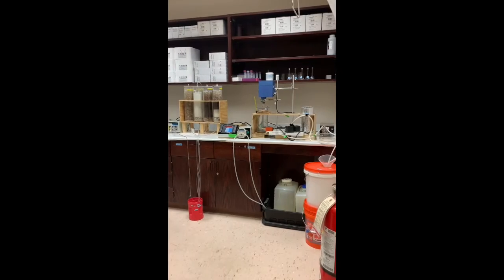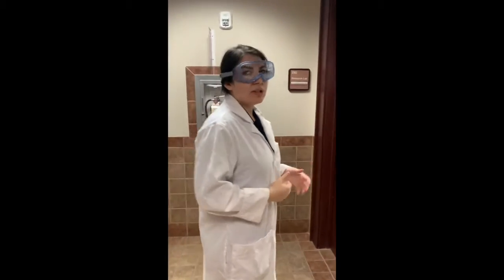labs that we have. So if we come down this hallway, we can actually see some of our other labs are used for research purposes. So in this lab in 231, we have our air monitoring measurements lab, where we can see some of our students are doing a column study. We can also come into 230, where we have our air emissions control lab.